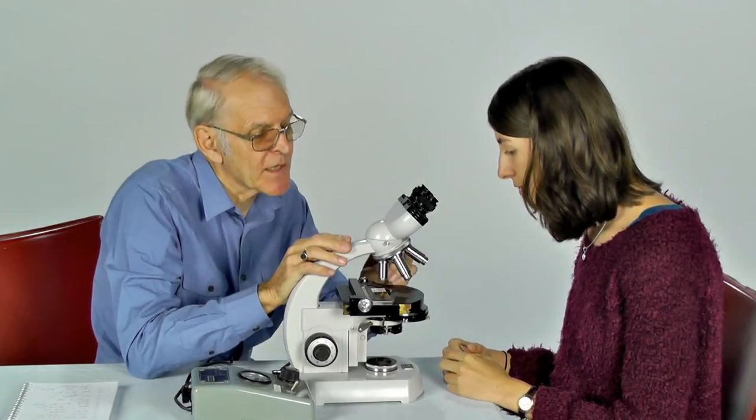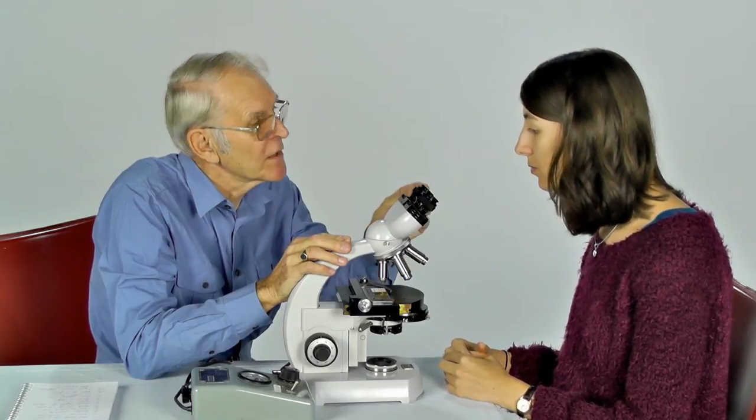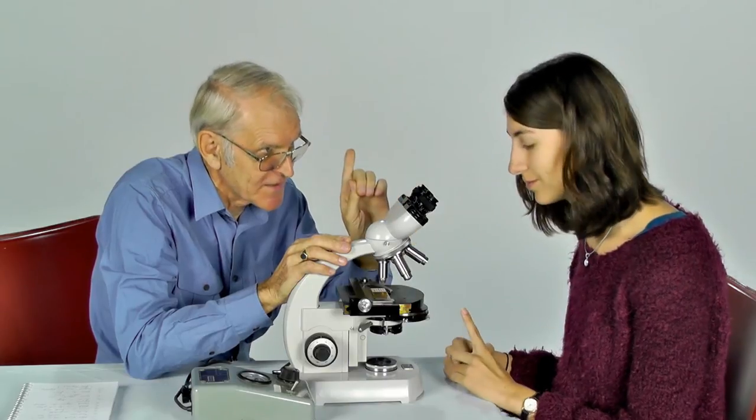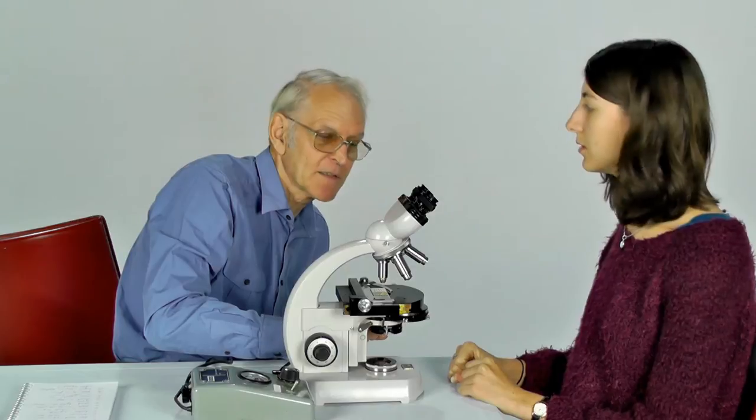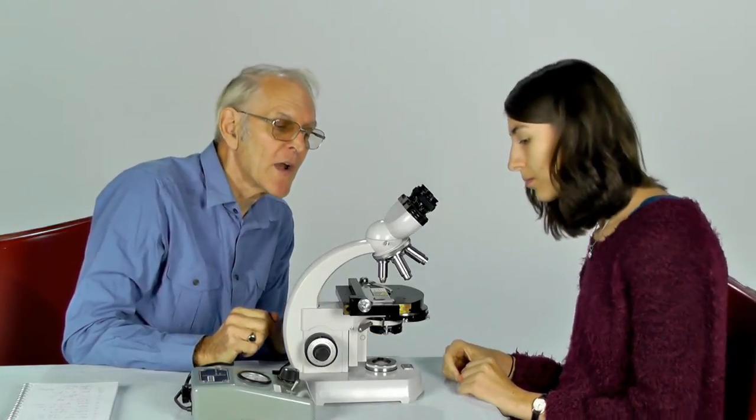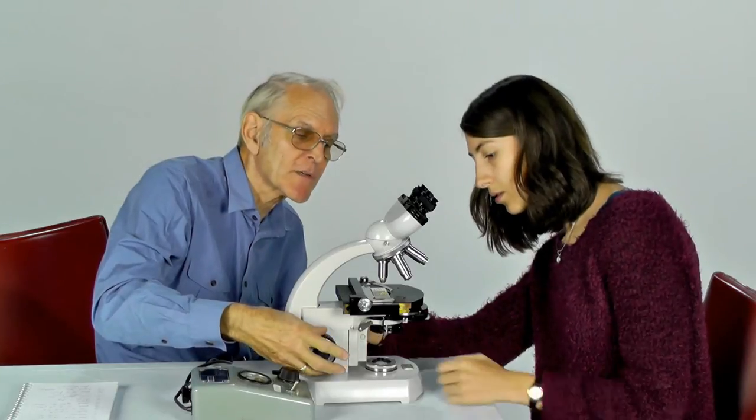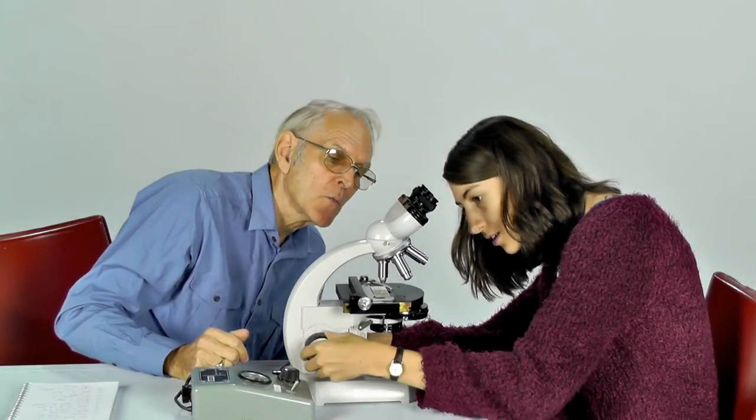Now at this stage we're going to try to get a clear view of that when we look through the eyepieces. But don't look through the eyepieces yet. You're going to look from the side initially and you're going to raise the stage using the coarse focusing adjustment. That's going up.